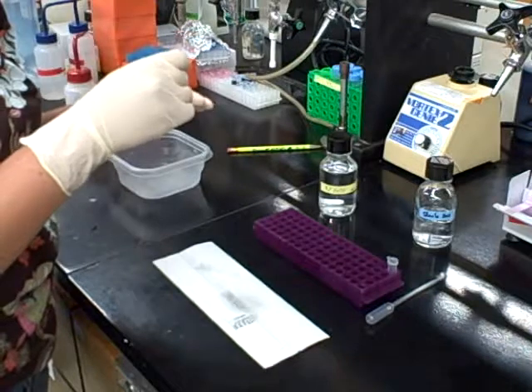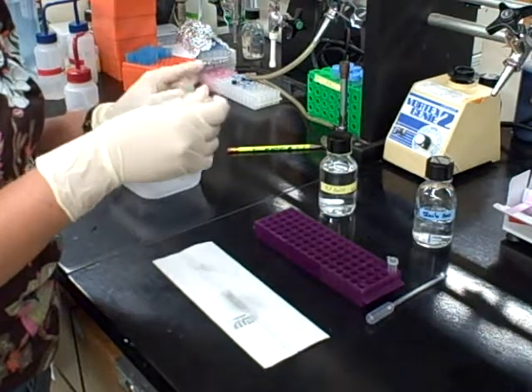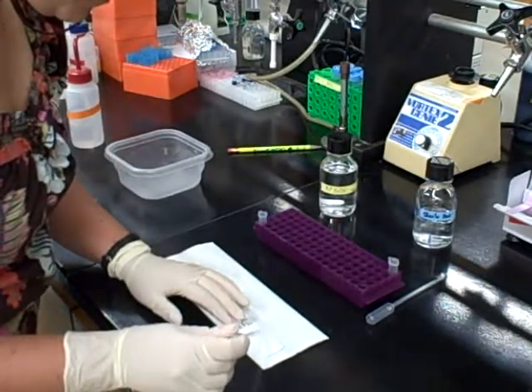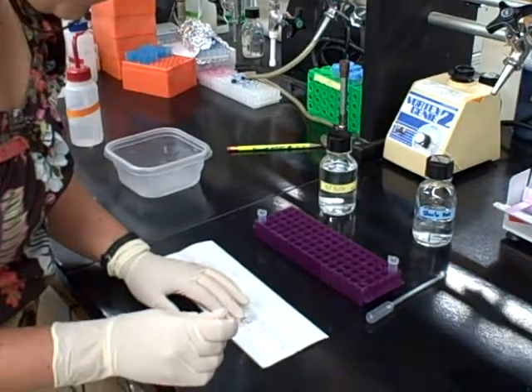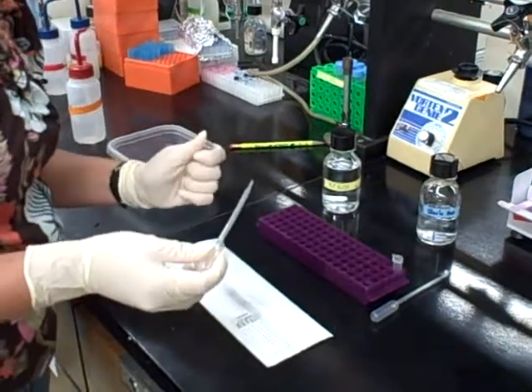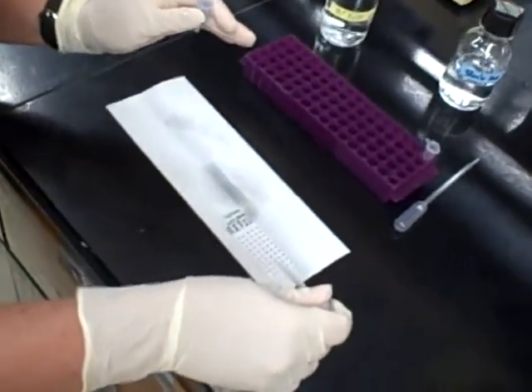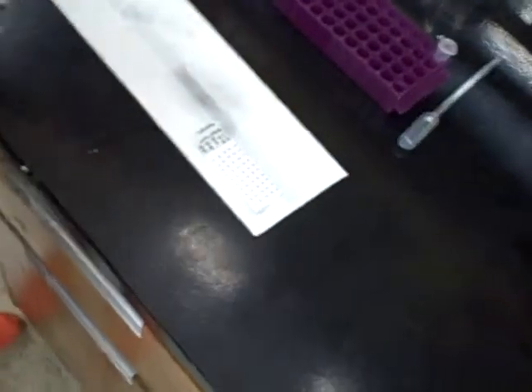The color reagent, which is 5% NaOH, is added. Again, the students would assume that this is specific to the actual cDNA chemical. As you can see, the spots become more apparent with time — we do let these sit for about five minutes, and then wash off so the students can handle the slides.